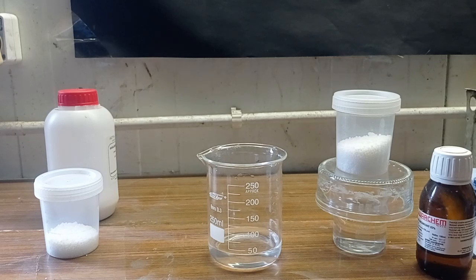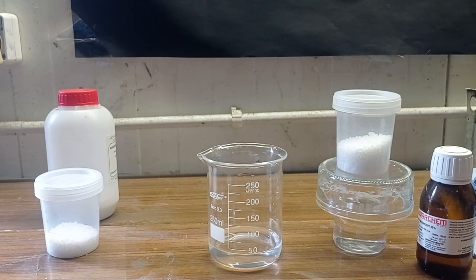So hi guys, today will be a very simple reaction because today I make sodium formate and sodium benzoate. The reaction is so simple that I think I don't have to give you the amount of my acid. And so I start with sodium formate.